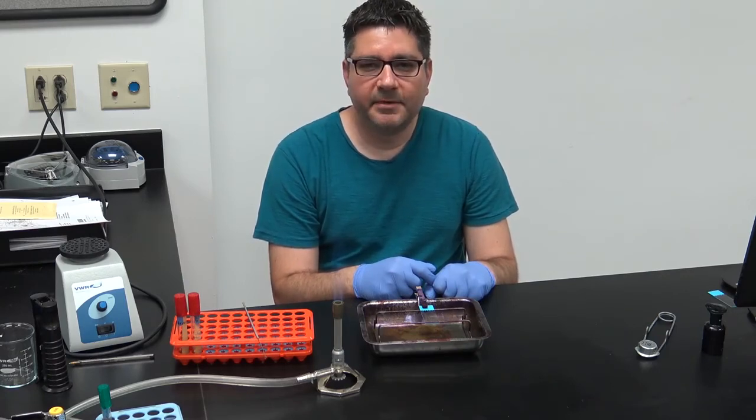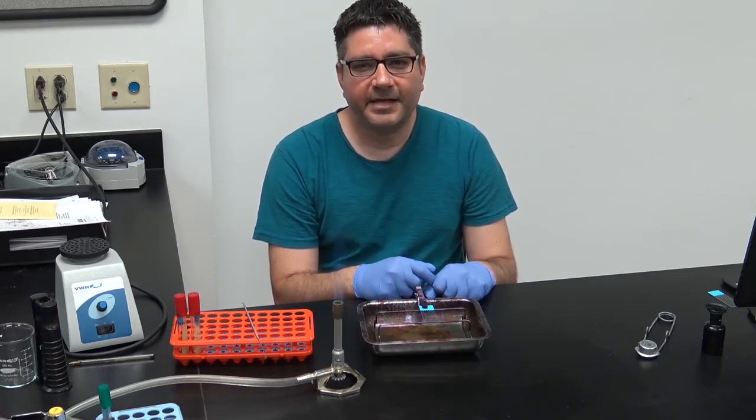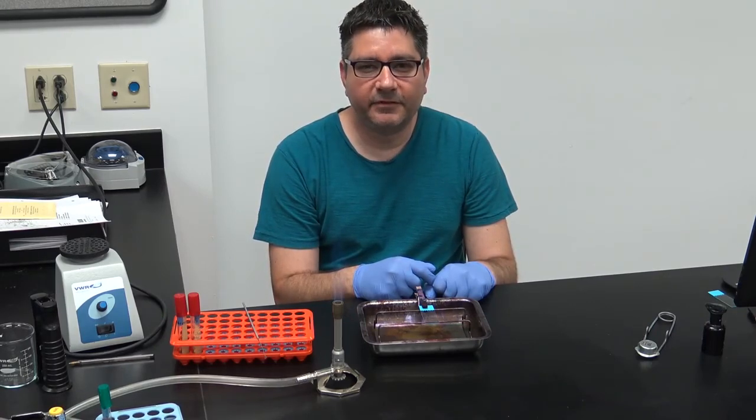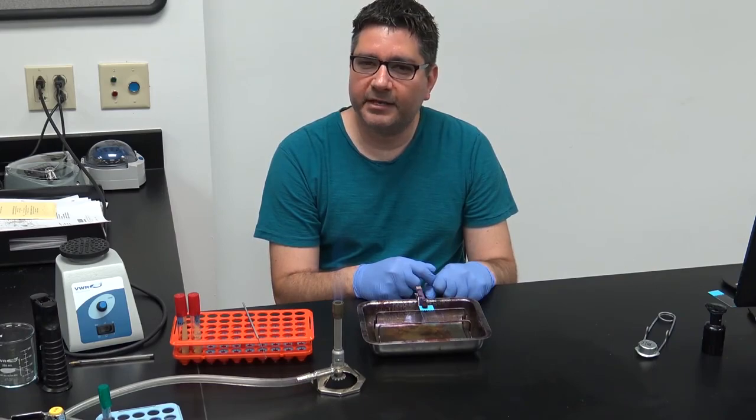When visualizing the mixture, you will see that acid-fast Mycobacterium will stain red, while non-acid-fast Staphylococcus will pick up the counterstain and be blue.